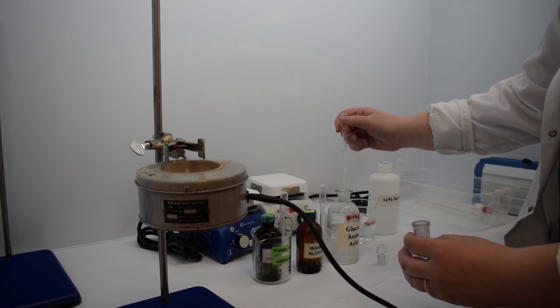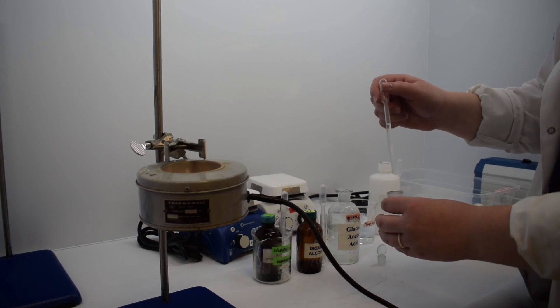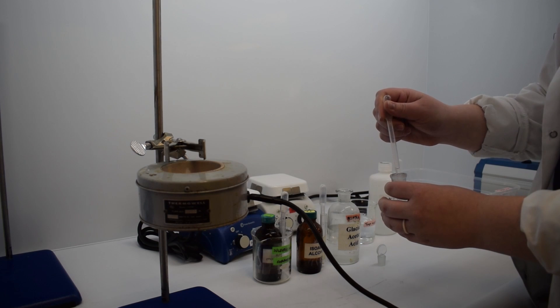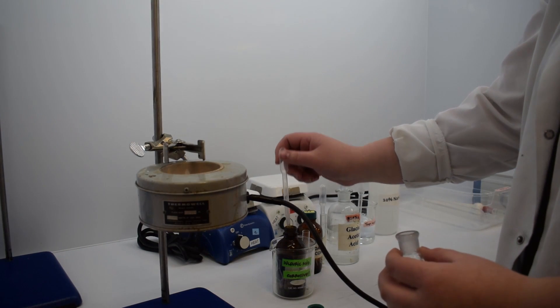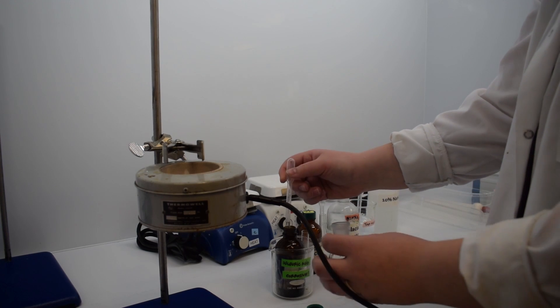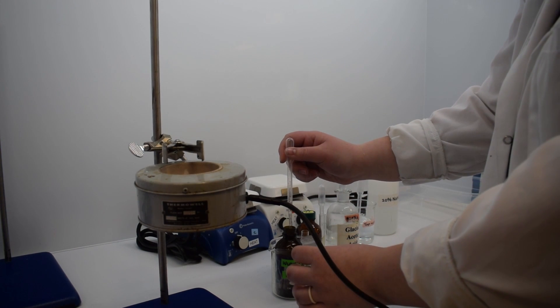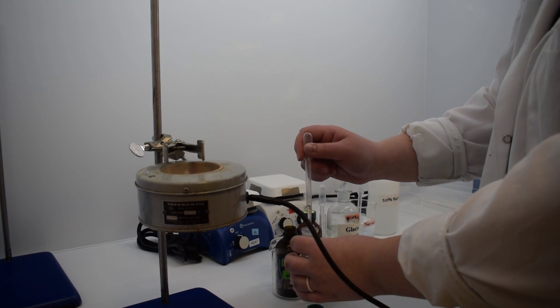Next, we added three milliliters of acetic acid followed by two drops of sulfuric acid. There are only two drops of sulfuric acid because that is the catalyst in this reaction, so we only require a catalytic amount.